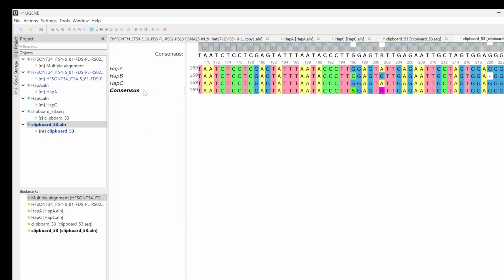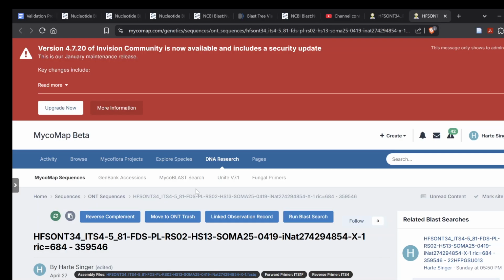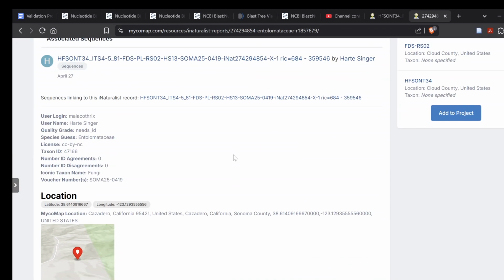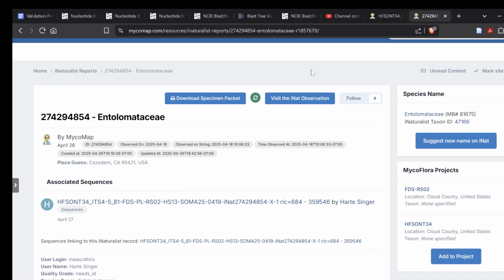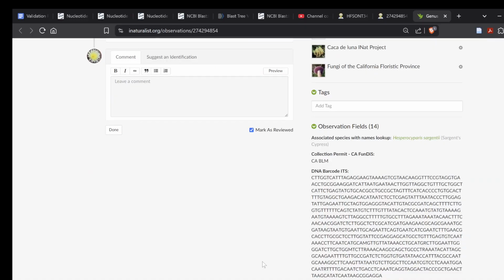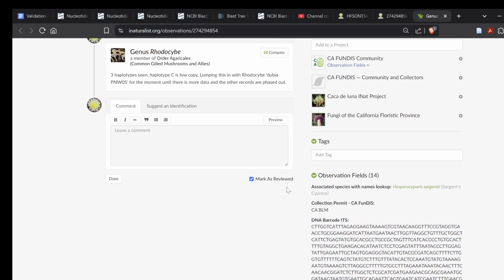And so now I've got my consensus, so now I can go into iNaturalist, which, goodness, I'm lost. There it is. I can go on iNaturalist, and here's what I'm going to do. Hint, hint, I already did it. So for the DNA barcode ITS, that's where you would put your consensus sequence. And then you'd also add that to MycoMap.